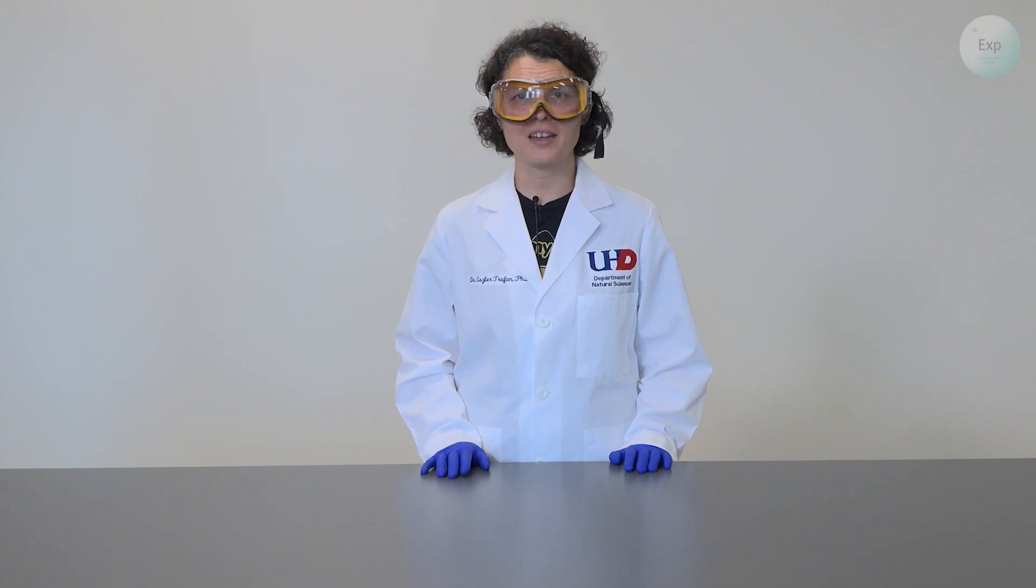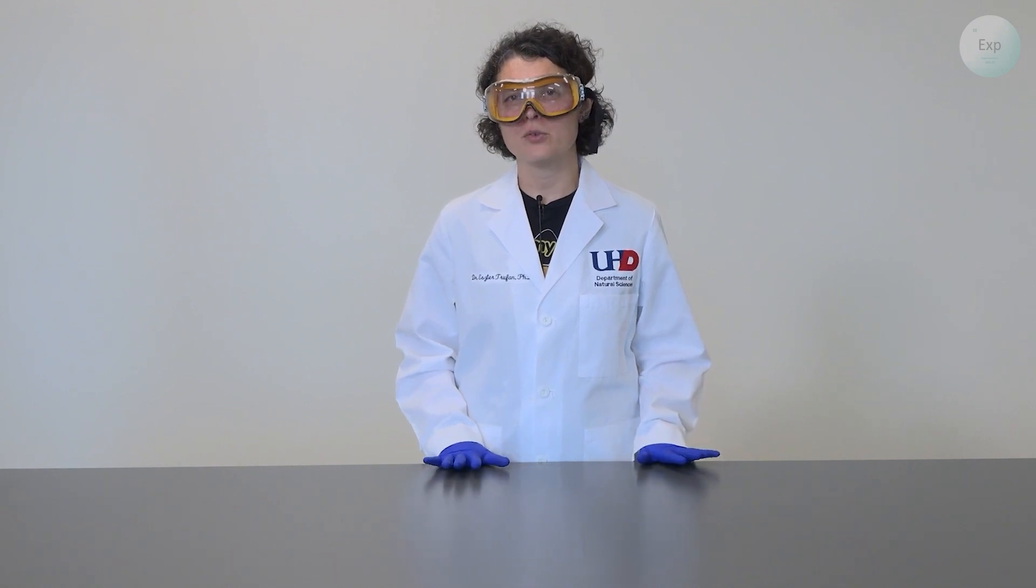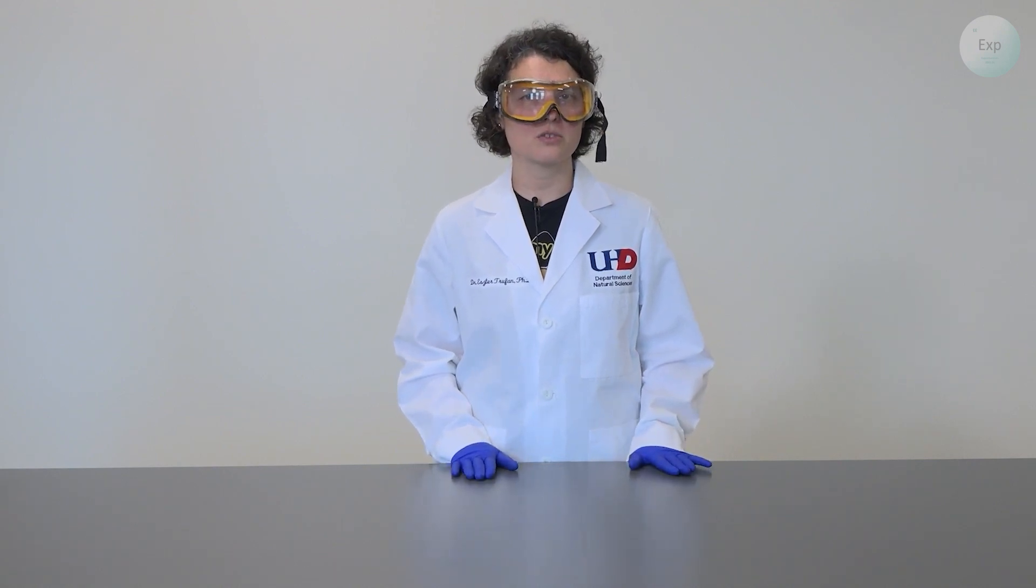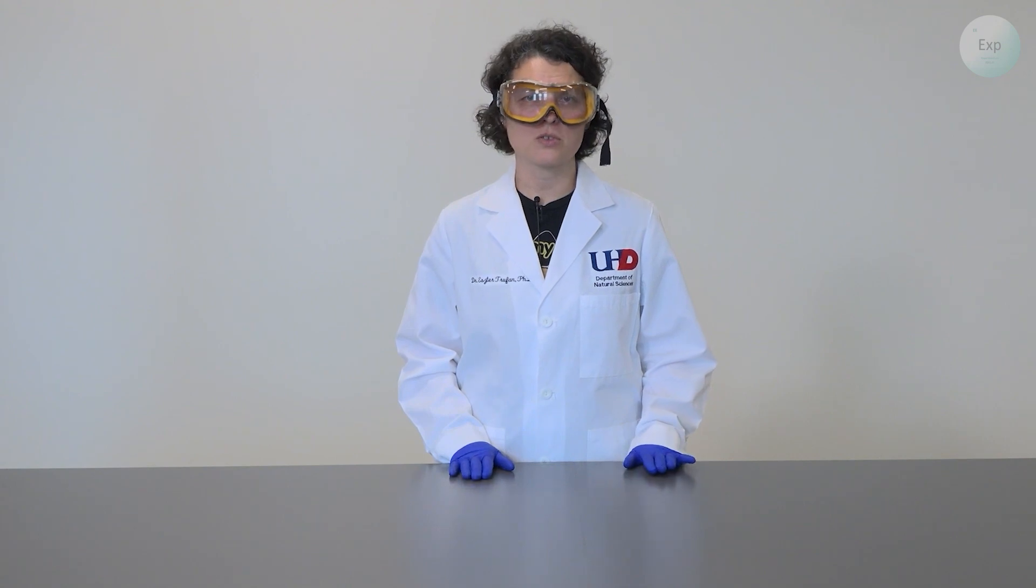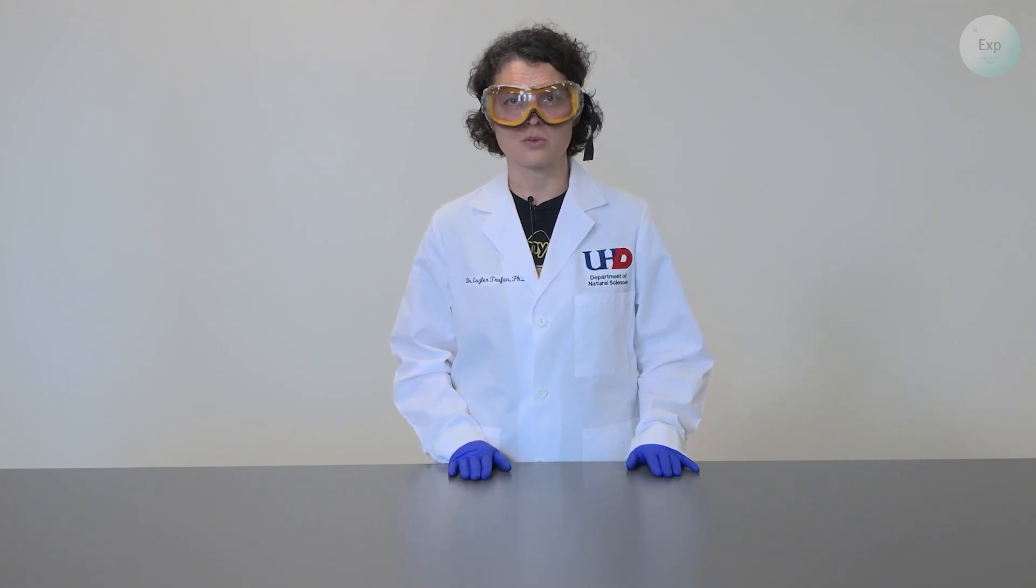Hello, my name is Dr. Esther Trufan, and in this video I'm going to demonstrate how to maintain your seed crystals, which is essentially a way for you to strategically select which crystals you want to grow further and which crystals you are ready to discard at a very early stage in the crystal growth process.